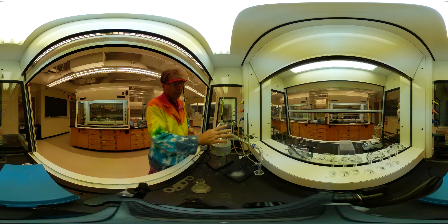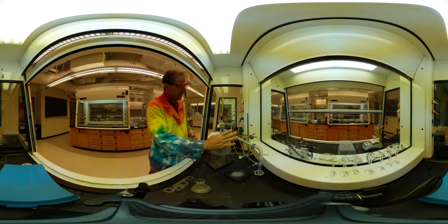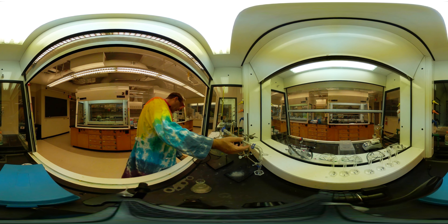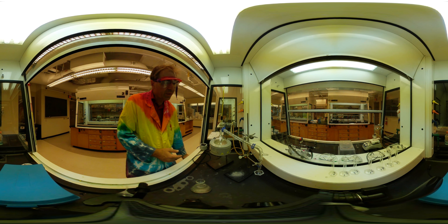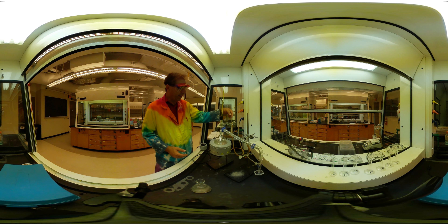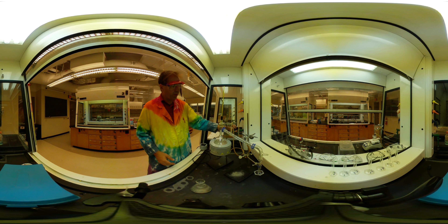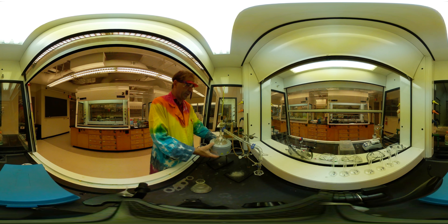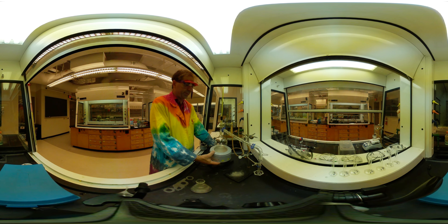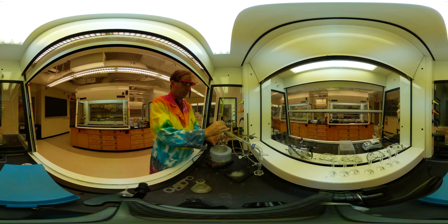The setup is fairly similar in that I have my condensing column and my water that's going to be coming in the bottom. Let's get that going — fill that up, it's going out to the top. I made sure that the hoses aren't touching the heating mantle here. I have my graduated cylinders over there that have been pre-weighed and they're ready to go. So I'm going to drop this down and we're going to add our sample to it.